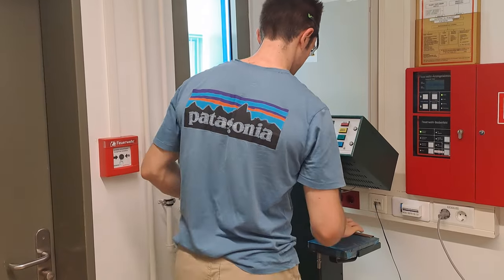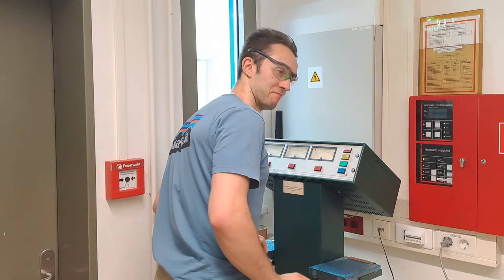Today, I'm going to show you how to extract measurable amounts of polonium-210 from uranium ore. This experiment was originally just a proof of concept, but it worked so well that I decided to make a video about it.